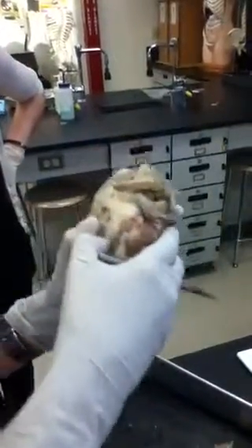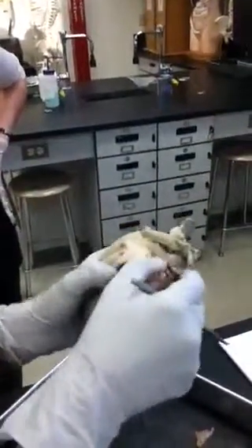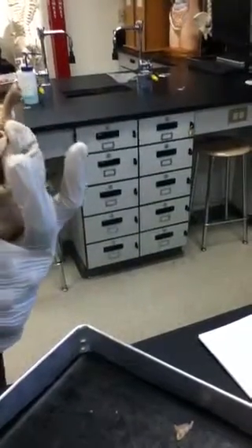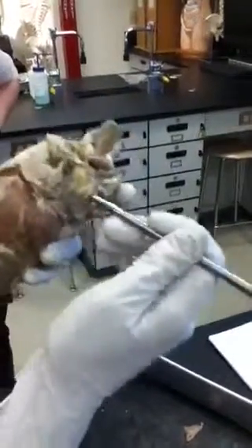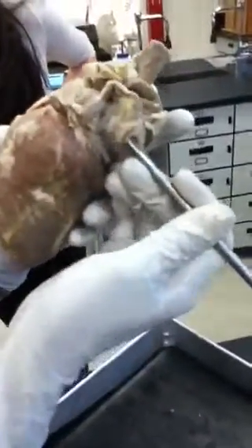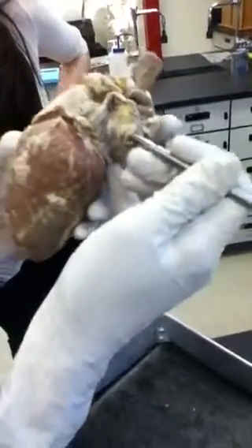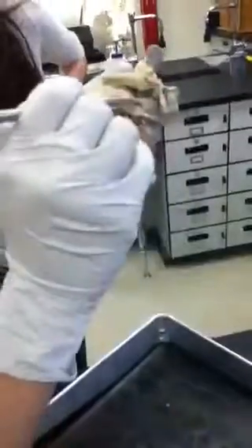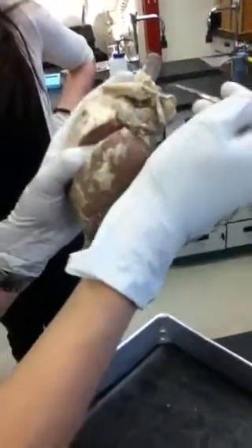So when we open up our cut here, we want to cut this a little bit more. When you cut this, you should actually be able to see where your pulmonary veins are coming into your left atrium. So you want to cut this a little bit more so you can see in here. This is a pulmonary vein, and you can see when I move my probe, it's actually moving inside the left atrium. So blood goes from the lungs into the left atrium via the pulmonary veins.